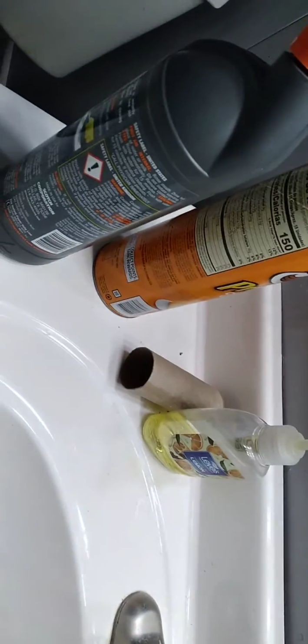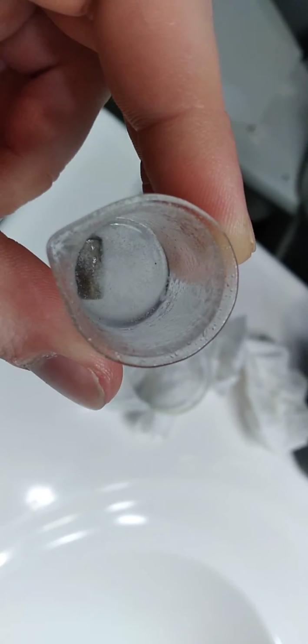Well, a lot of it's gray. There's still some yellow. There's still just a hint of purple in some places. But yeah, for the most part, I've had some decent success with it. But it's gotten to the point now where it's getting so concentrated that I don't even know that it's doing much anymore, so I'm probably going to add some water to it and see if that helps.